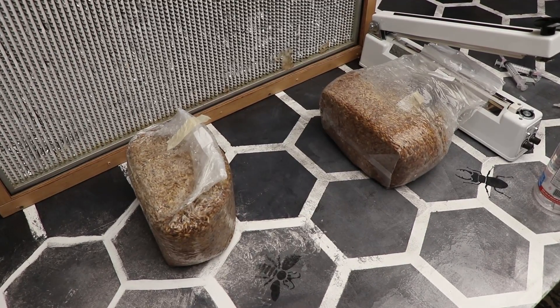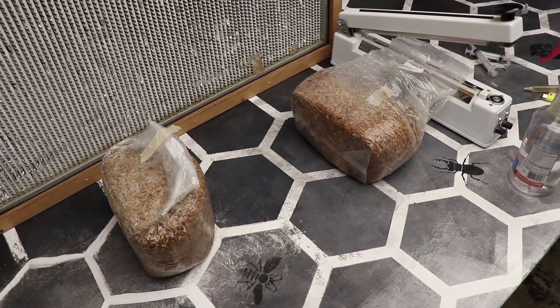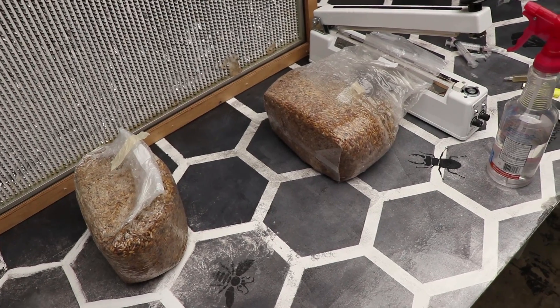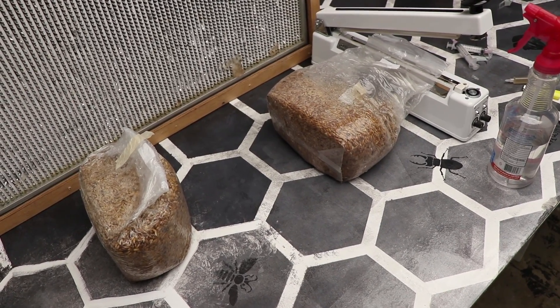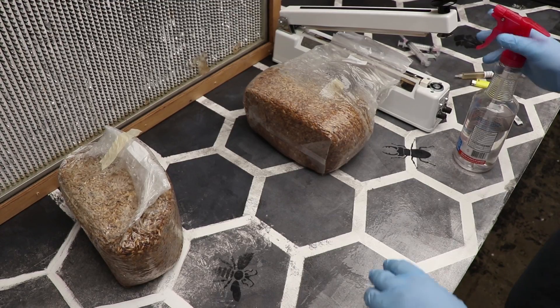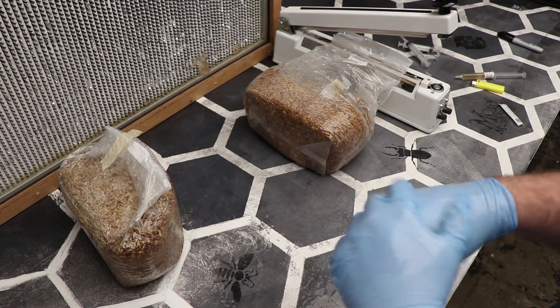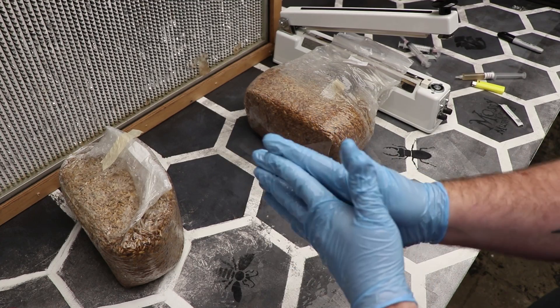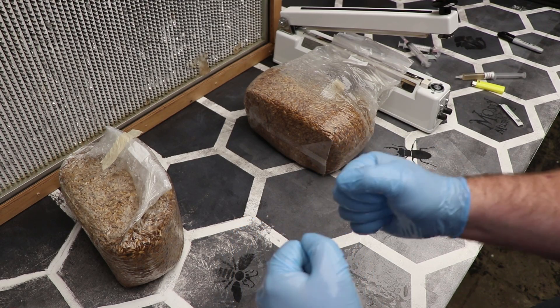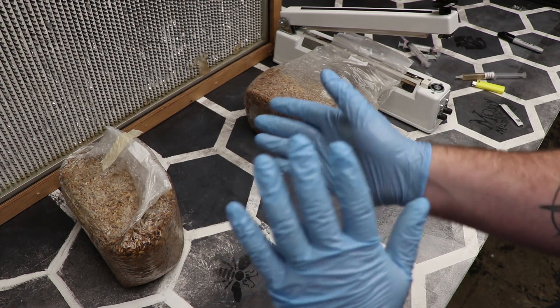The bag has done sealing. I had touched the camera monopod and had to fight with it to keep it from falling over — technical malfunction. Because I touched the monopod, I'm going to spray my hands back down with isopropyl to get everything clean. I do not like spraying isopropyl onto my hands unless I have gloves on — I prefer ethanol, like hand sanitizer, for bare skin or my arms. But as far as my hands go right now, they're covered in gloves, so I use isopropyl.